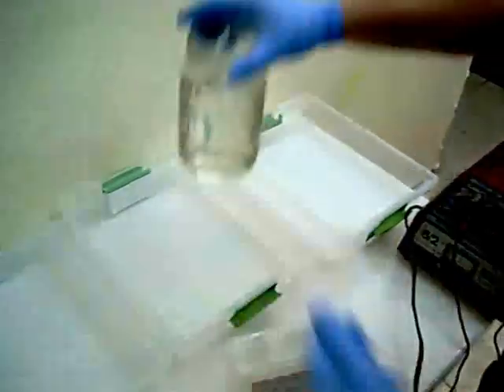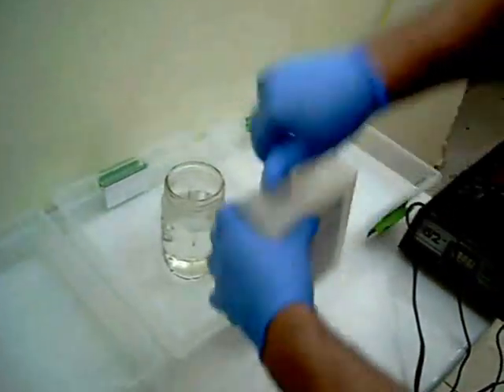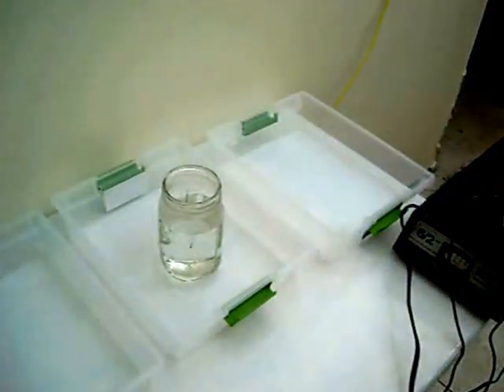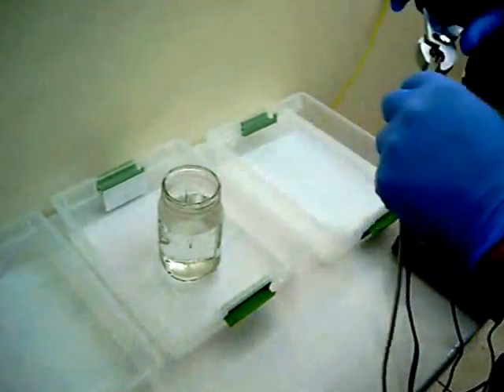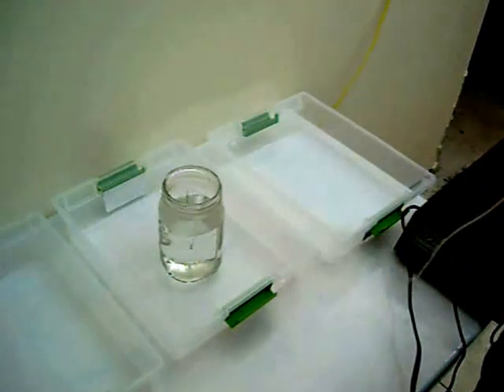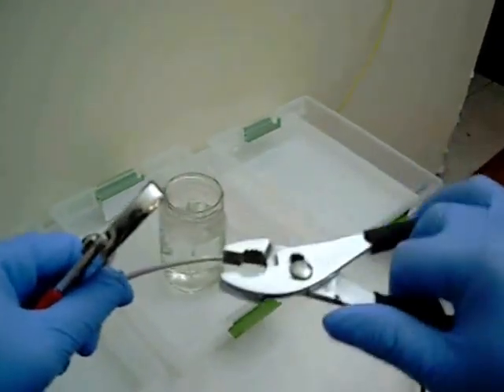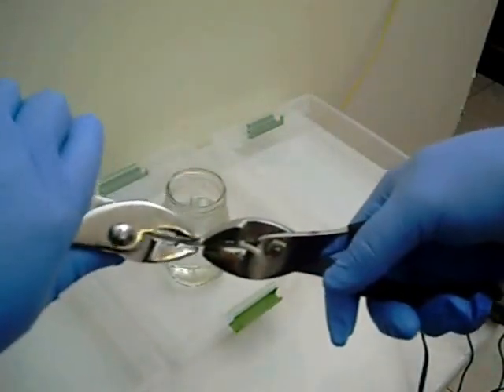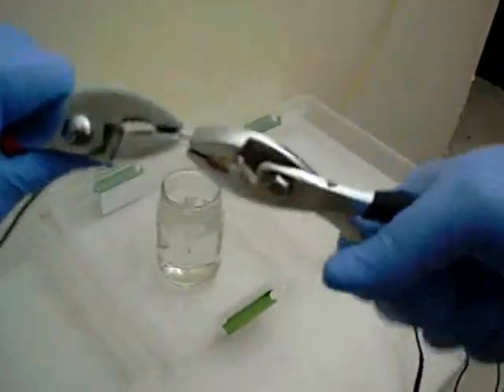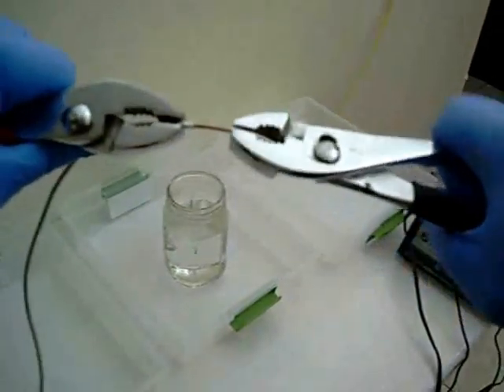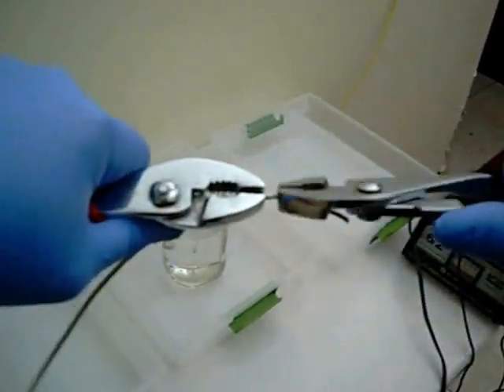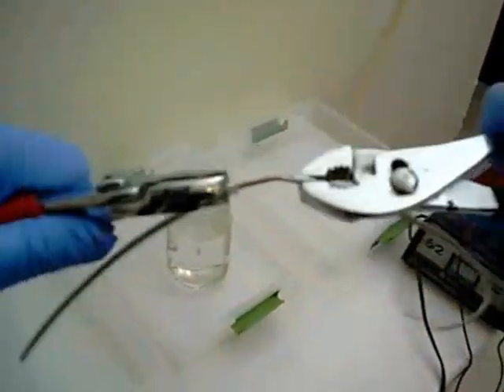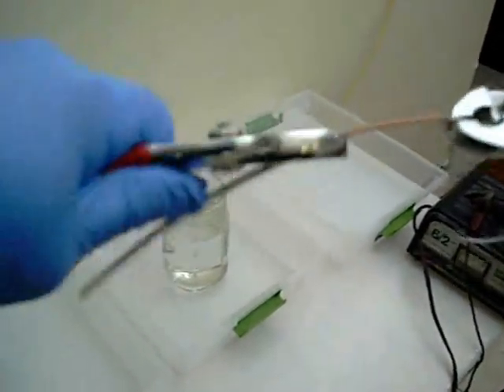You just need enough acid to dissolve a decent amount of the copper in the solution. Copper 2 sulfate is a redox reaction. For each molecule of acid, you're filling each molecule of acid with one atom of copper.